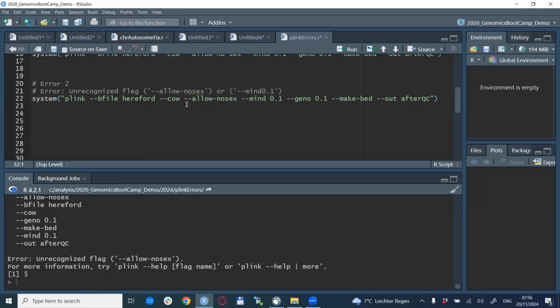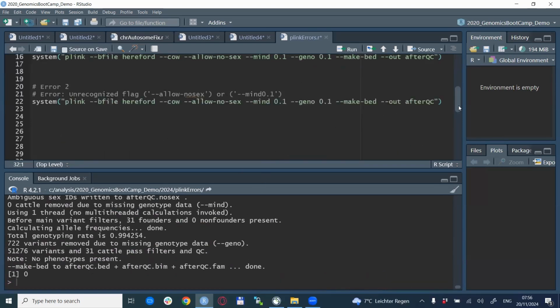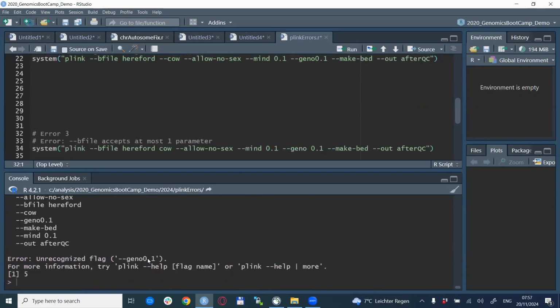In this case, it is --allow-no-sex. This is the correct way it's written. If we run this again, the line runs correctly. The same thing happens if you omit a space, for example. You might have --geno, and it should be followed by a space and the value. But if you omit this space, you have a similar unrecognized flag error.